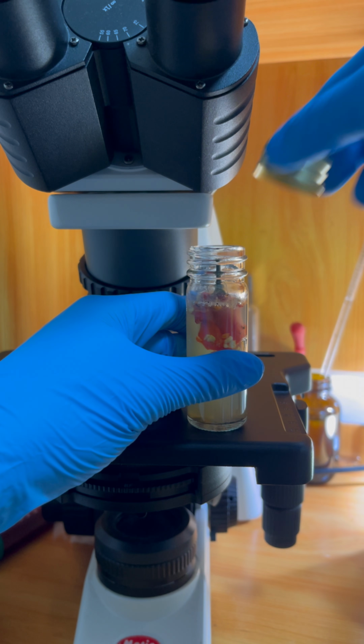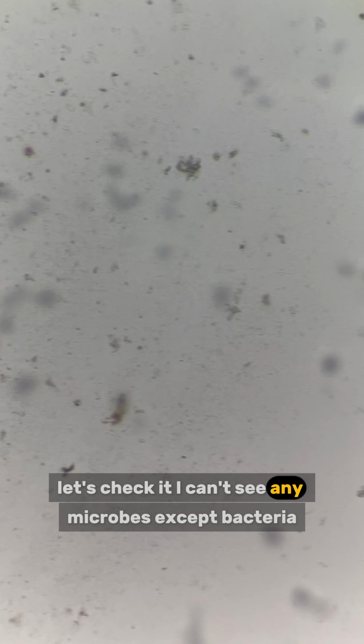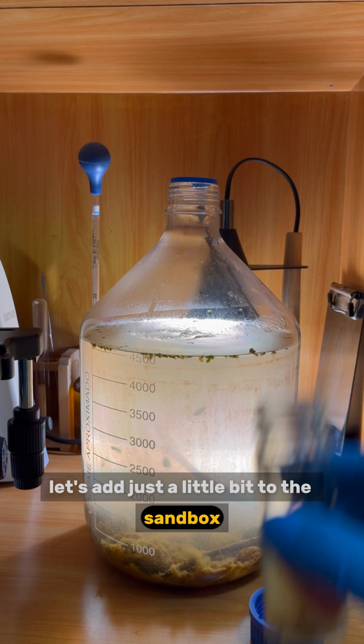Let's add stuff. Remember we mixed part of the sandbox with chili? Let's check it. I can't see any microbes except bacteria. Are microbes really scared of spicy stuff? Let's add just a little bit to the sandbox.